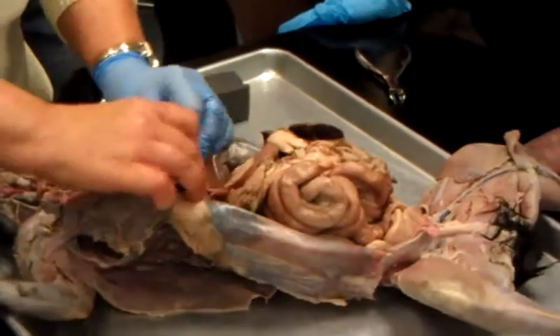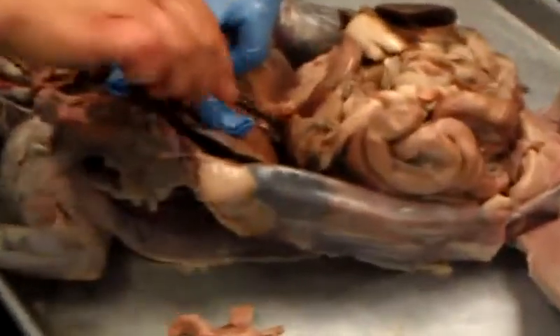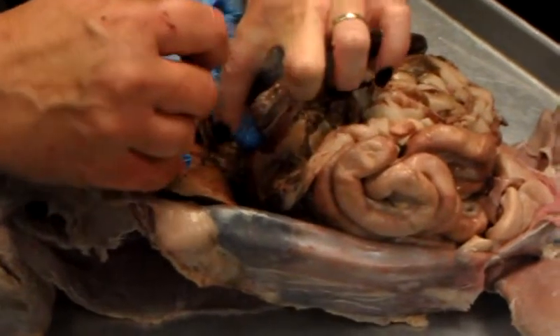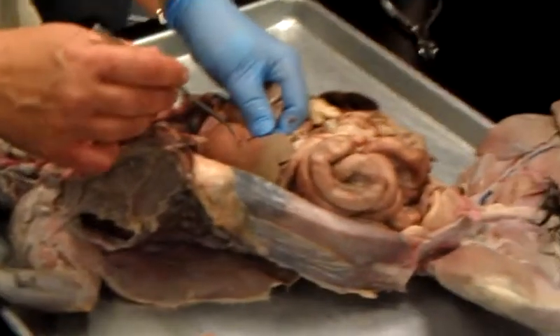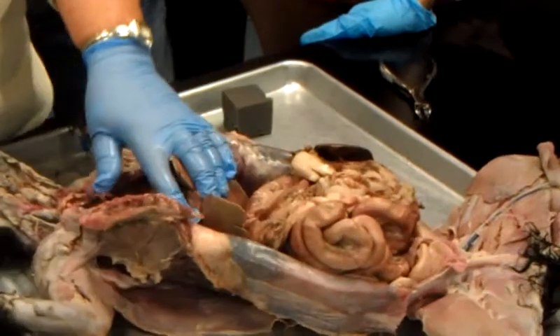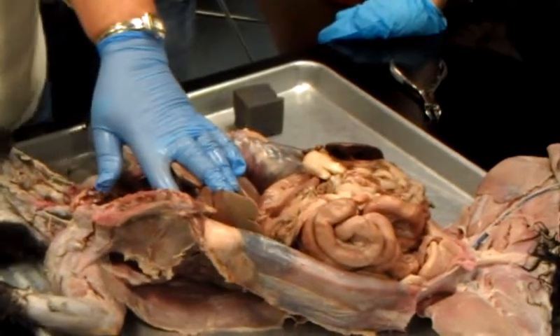Now, on the right medial lobe, on the underside, you should be able to see the gall what? Bladder. Now, on there, I have the ducts. They're really hard to find. Where's the gallbladder? This right here. Okay. Most of them are green, but this cat is very well preserved. It's right here. Okay, it's on the underside. See, I can see it there. That's the gallbladder, too. See it? Don't even try to find the ducts right now on the cat. I think we're going to do the ducts on the model. They're very hard to see.